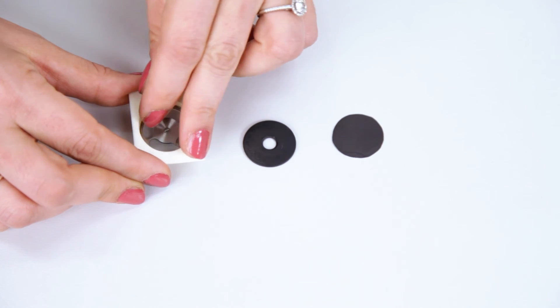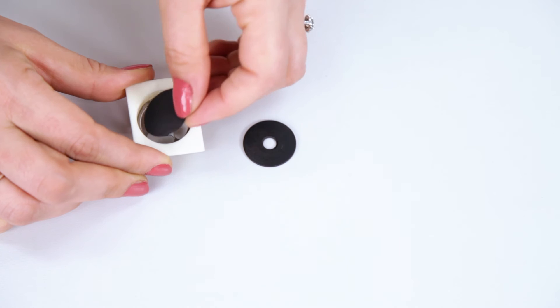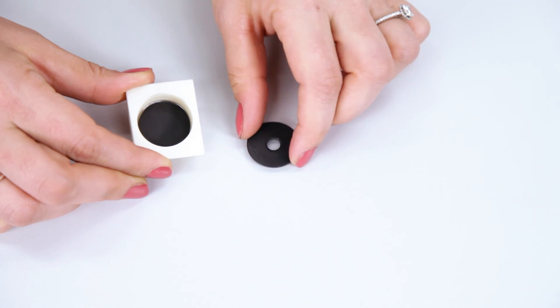So the bottom mask goes first, then the sample, and then the top mask.